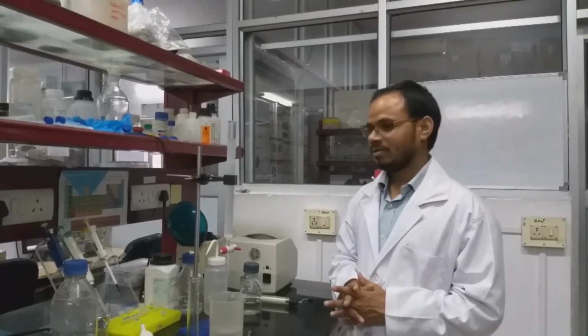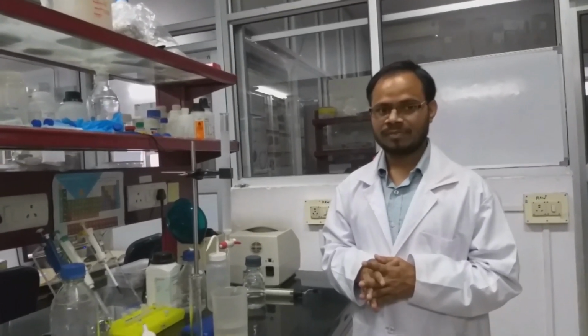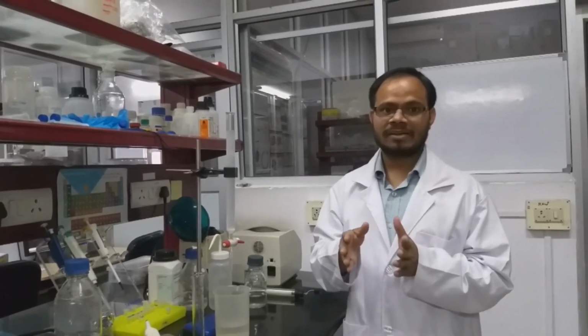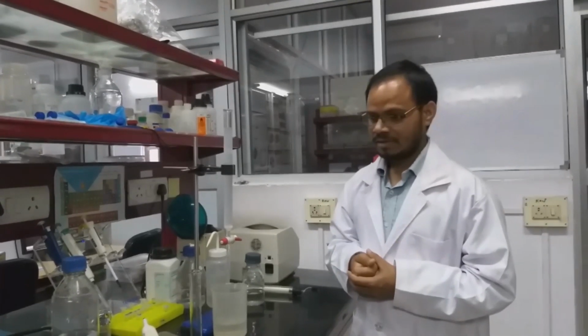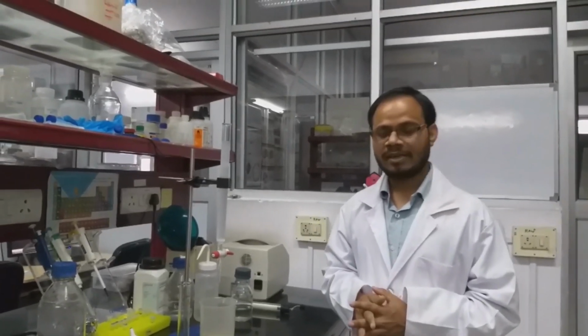For calculation of any unknown protein's molecular weight, we should know VT, V0 and VE. VT is the total volume of the column, meaning the buffer occupying the spaces inside the beads and also the buffer in between the beads. So that will be the total volume. The void volume is the buffer in between the beads. Elution volume is where it elutes. Suppose we are eluting a protein, the volume at which it elutes is called the elution volume.